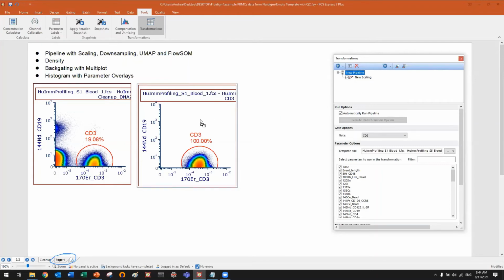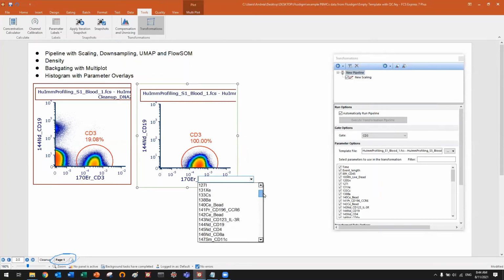If I apply my pipeline on my plot, you will see that now I have new data in this list. And the data in this case are the scaled version, as you can see here, of all the selected parameters. So you see, step one in my pipeline is generating new data, and we can use this new data for the second step.